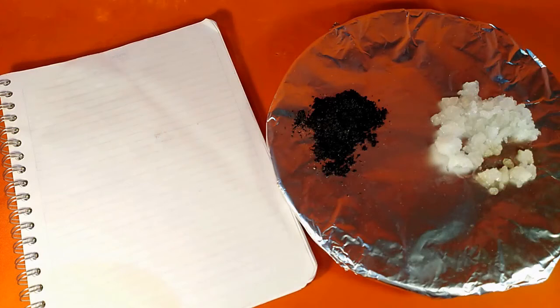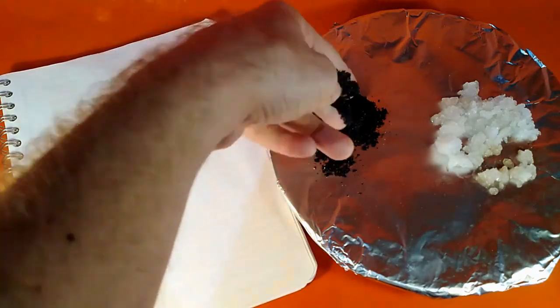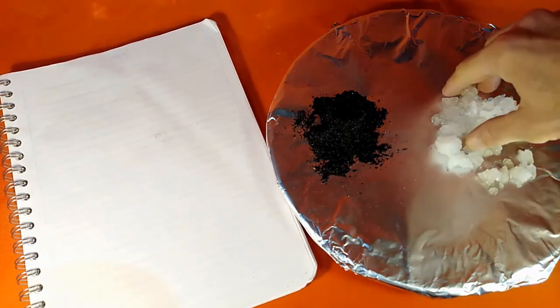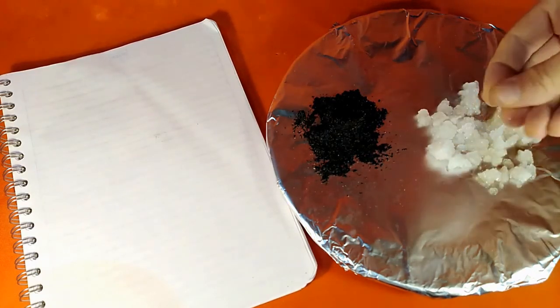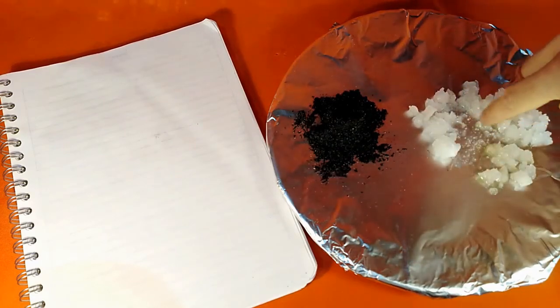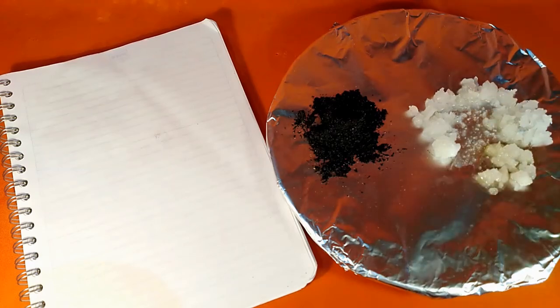Okay, and let's take a look here at an interesting difference in the physical properties, the difference between salt and sand. And I have here a surface covered with aluminum foil because I thought it might show up a little bit better. We have a pile of sand. I put this out yesterday, and as you can see, the sand is still pretty dry. Now, the salt, on the other hand, you can maybe see is very, very wet. You can even see that there's maybe kind of a puddle of water down here in the middle of the salt.